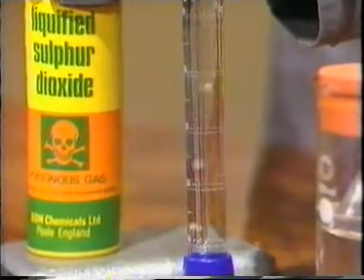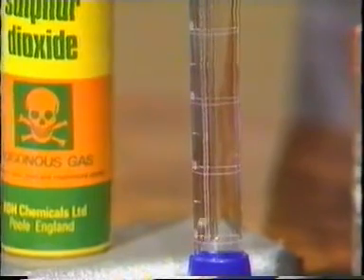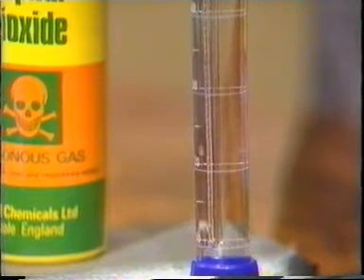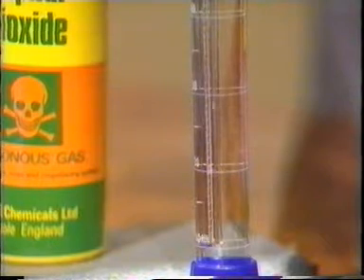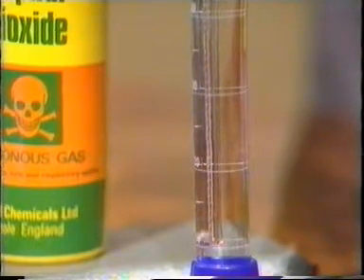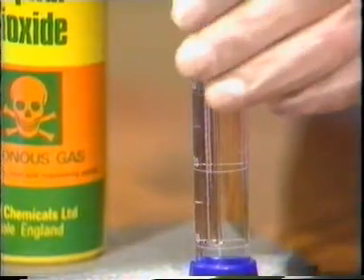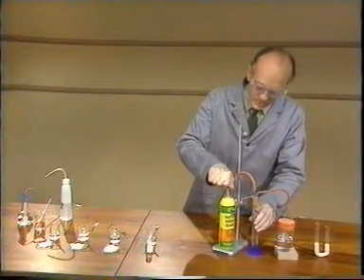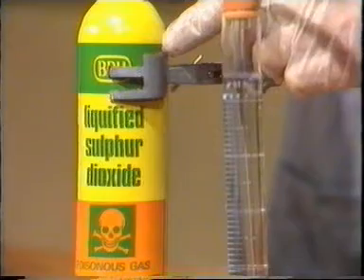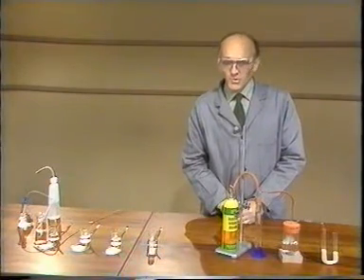As we carry on and flush out the air in the tube, now we're getting sulfur dioxide coming through, and you can see the bubbles getting smaller as they travel up and disappearing altogether before they reach the surface. The gas is very obviously dissolving, and in fact it's a very soluble gas indeed. I won't measure the temperature change, although there is some sign of a slight warming, despite the fact that the gas, as it leaves the cylinder, cools down because of the release in pressure. Dichlorine monoxide is even more unpleasant and toxic, so I won't be showing that one to you at all.